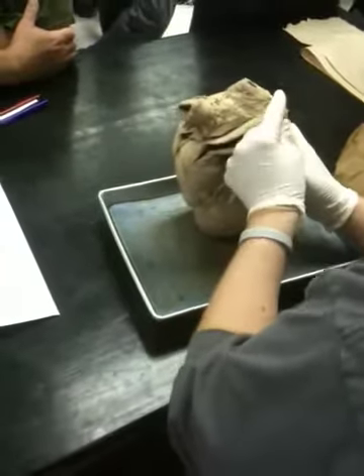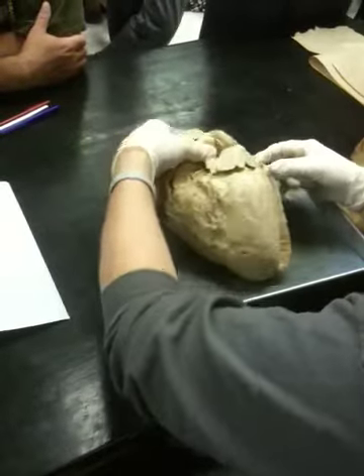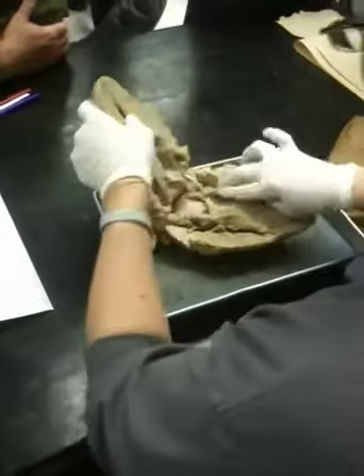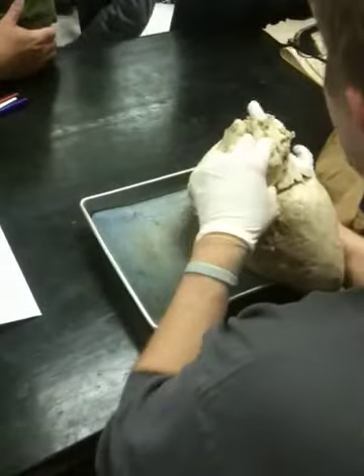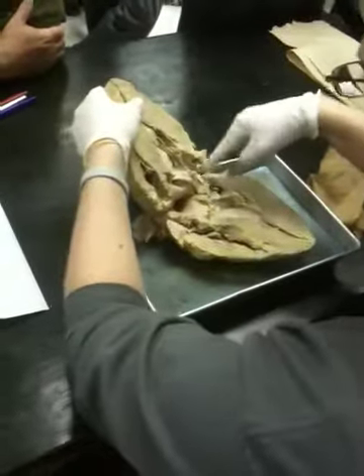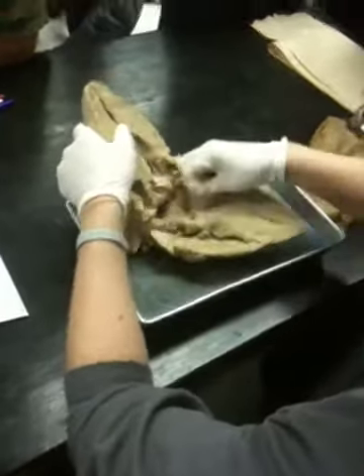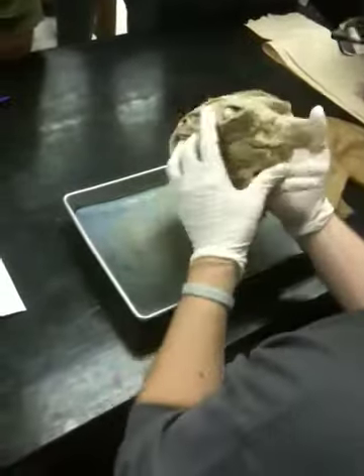The pulmonary veins are going to come into this side, the left atria, and you can see the holes on the back side of the heart here, where they come into the atria. So here's the left atria. Where my fingers are sticking out are basically the pulmonary veins coming in. They come into this region, and then they go down to the left ventricle, where the left ventricle pumps the blood out through this flap right here, the semilunar valve, and goes out through the aorta.